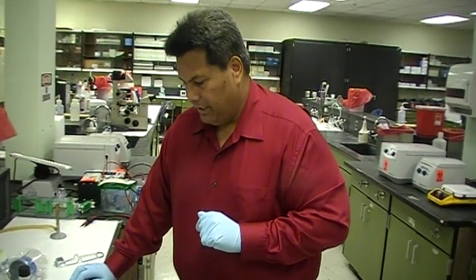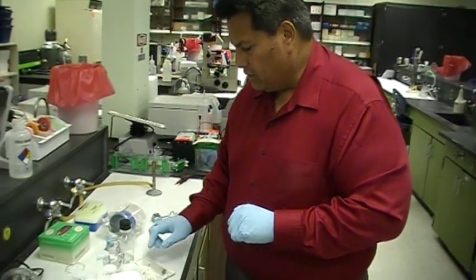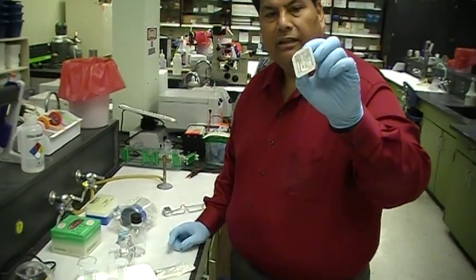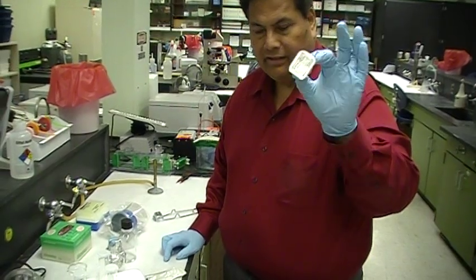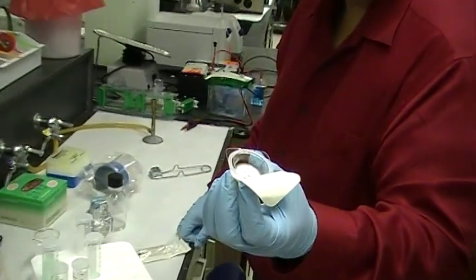And so I'm going to begin by showing you how we sterilize small volume of solutions that cannot be autoclaved. So this one, I use a syringe filter. And that is, you get a filter like this, which is called an acrodisc. And it is like so. And you open it from the top, and you leave it open. Okay?